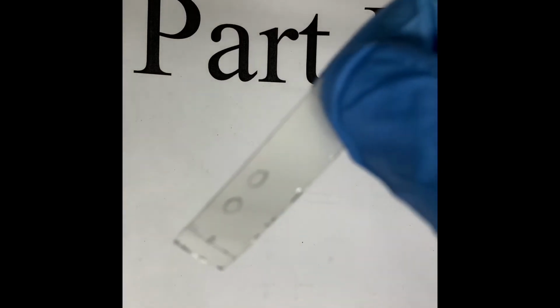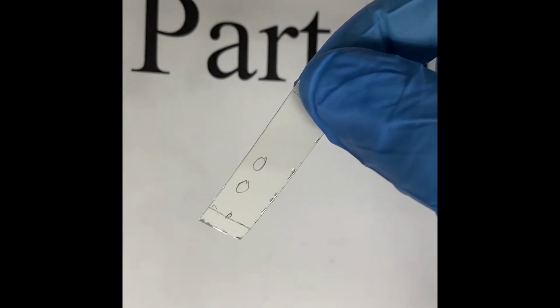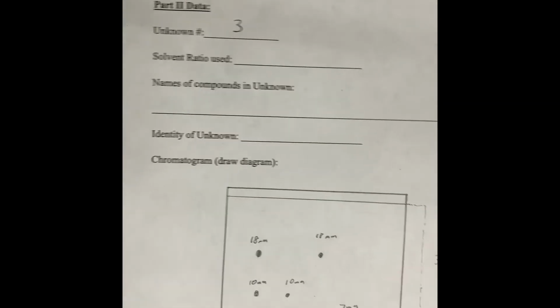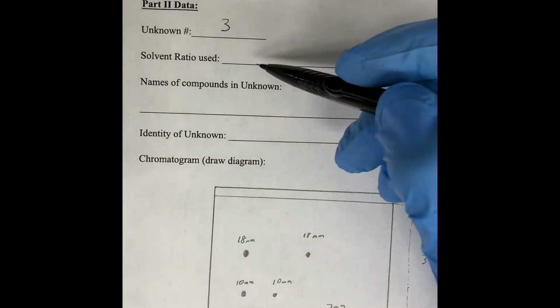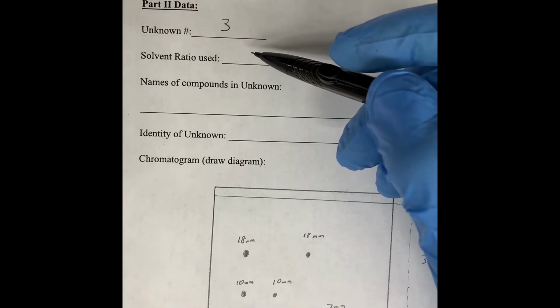All right, so we're ready to move on to part 2, and the goal of part 2 is to figure out what each of these spots are from part 1. And so on the data sheet for part 2 on the lab handout, what we're going to do is use the ideal solvent ratio to run another TLC plate.